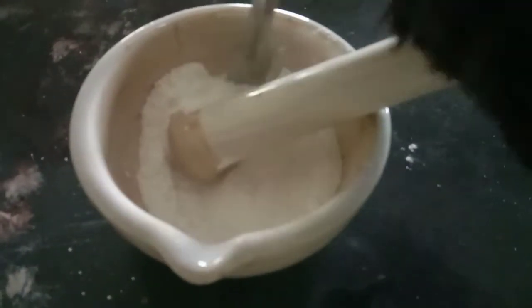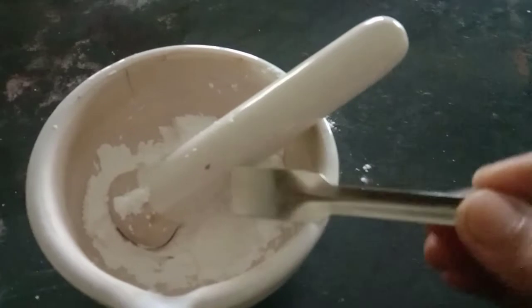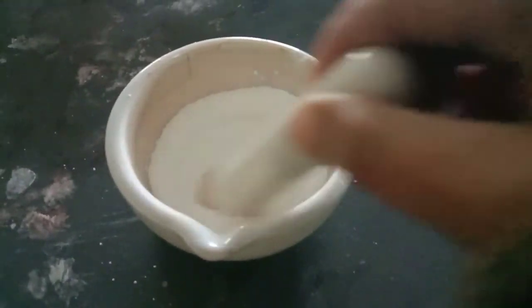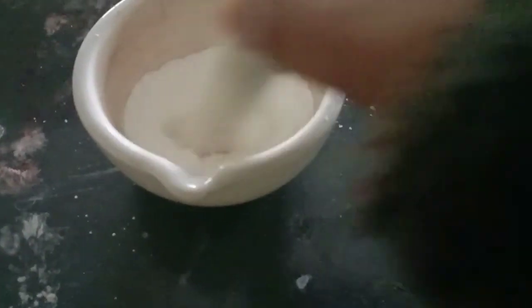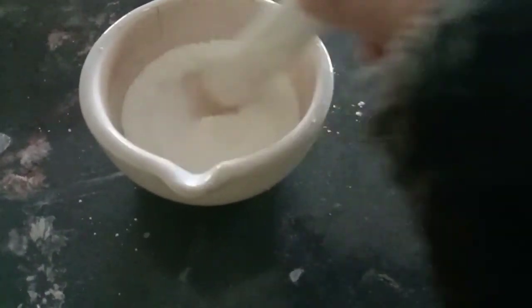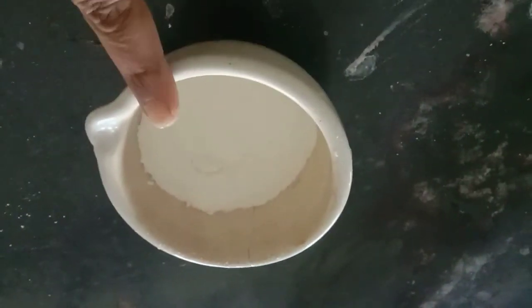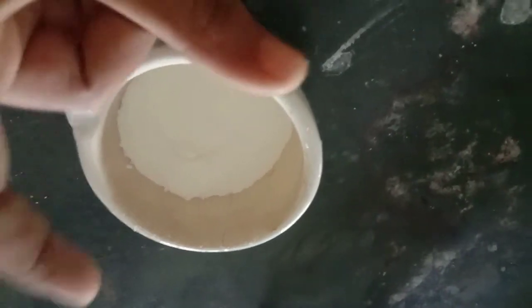You can take the help of a spatula to scrape it. Mix it properly and well until the compound magnesium trisilicate oral powder mixture is ready.